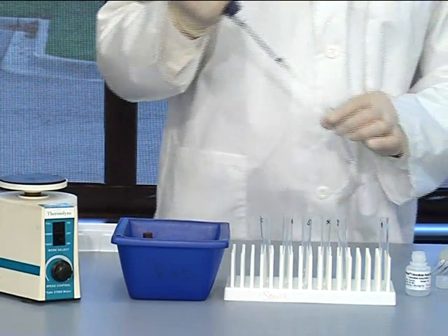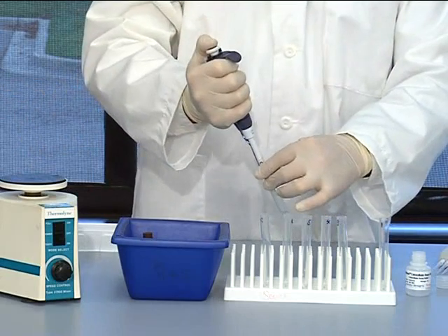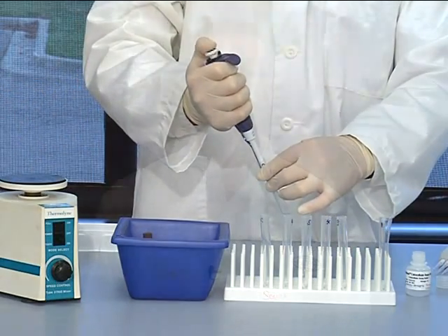Continue with this procedure for the remaining tubes four through seven. You now have a complete standard curve to be used in your multiplex assay.